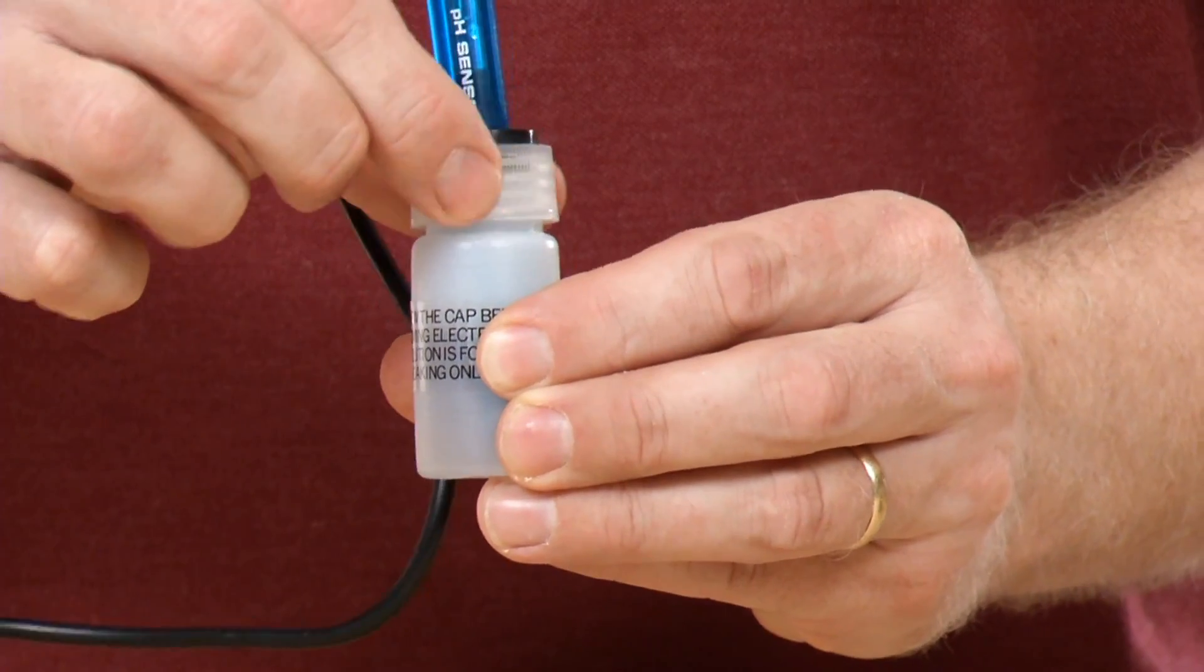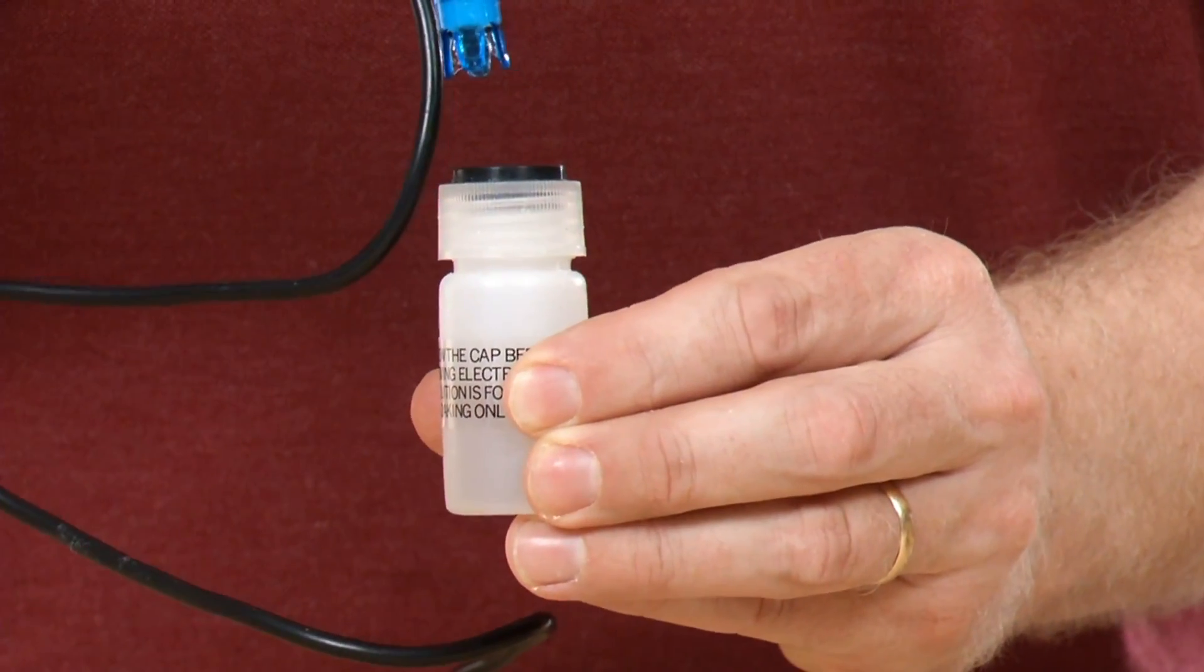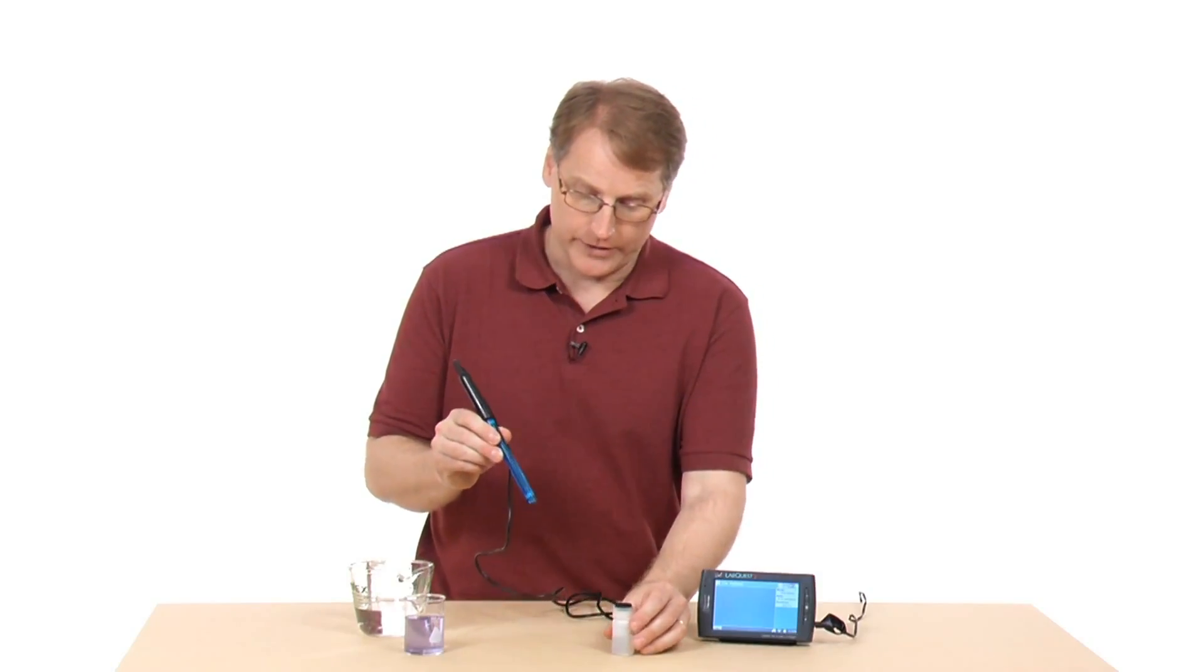I'm going to unscrew this cap. As I do this, it loosens this gasket. I'm going to pull it out, and now I'd be ready to use it.